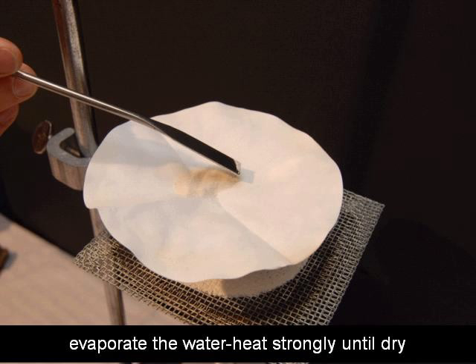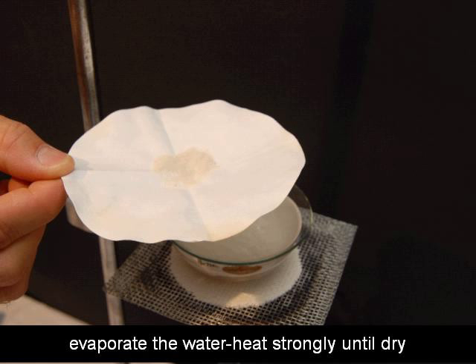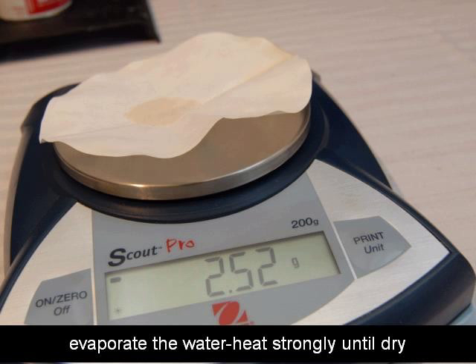And after you lower it down, keep an eye on that filter paper because the edges of it could start burning a little bit. And you'll lose mass of the filter paper and get an error in your recording if you burn it too much. So just move it around if one edge looks like it's getting a little brown. Move the filter paper and adjust it so that that stops occurring. Take a spatula and spread the sand out. And that will help it dry faster. And it's going to dry first. It's going to take longer for that salt water mixture to all evaporate off. But once it looks like the filter paper and sand is dry, then go ahead and remove it. And then you can immediately weigh that. And you can see this weighed 2.52 grams with the filter paper and the sand. Record that mass in your workbook.